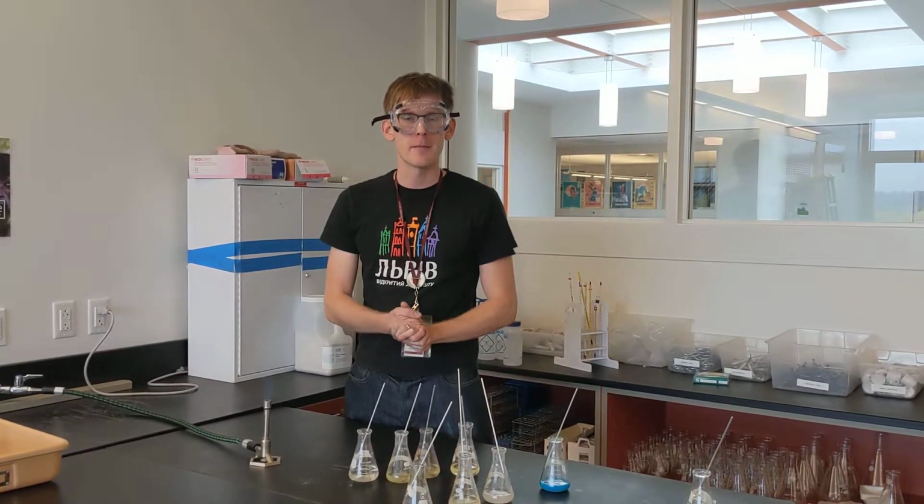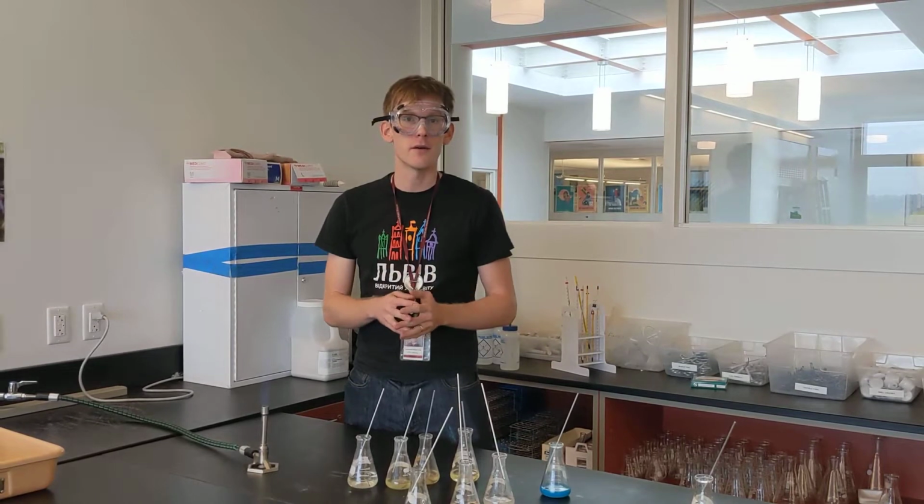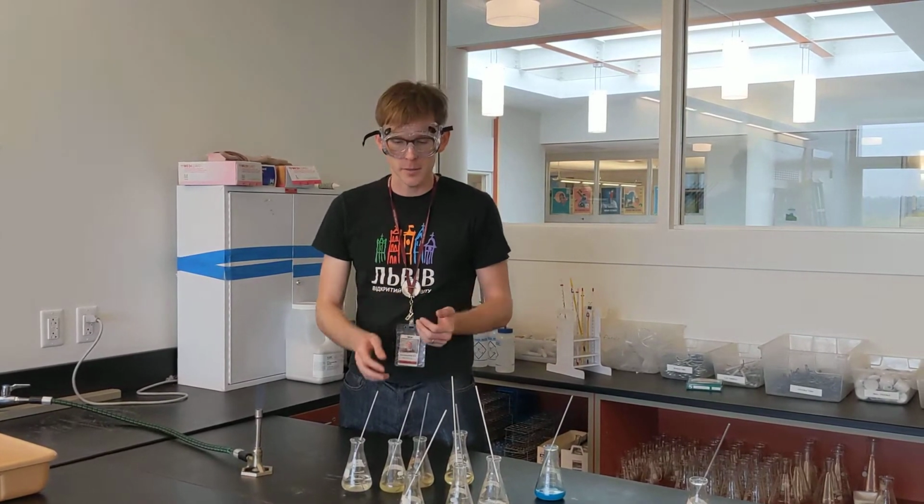Welcome to the Flame Test Lab. A flame test is a test to determine the identity of a metal that might be in a compound.